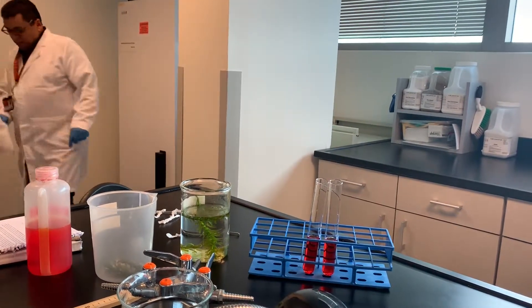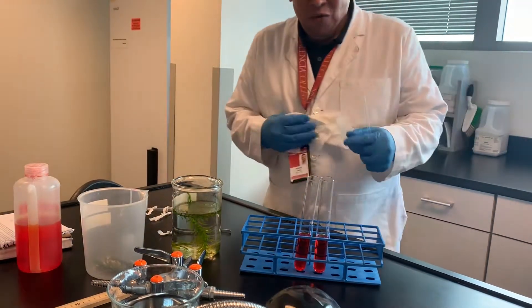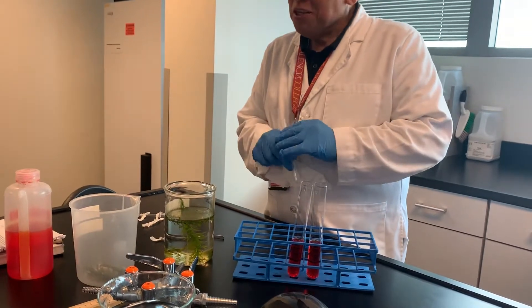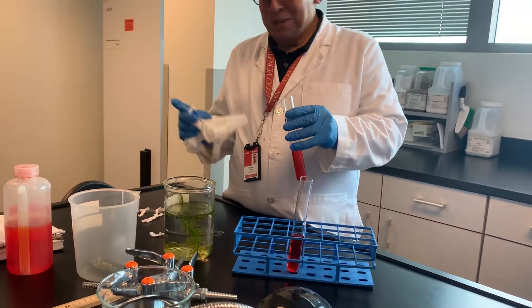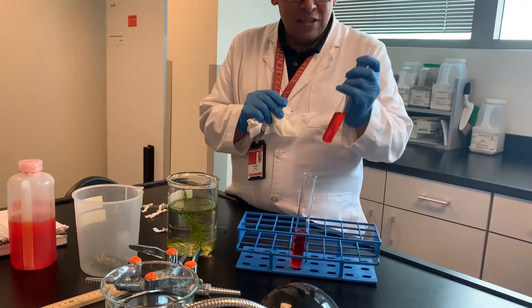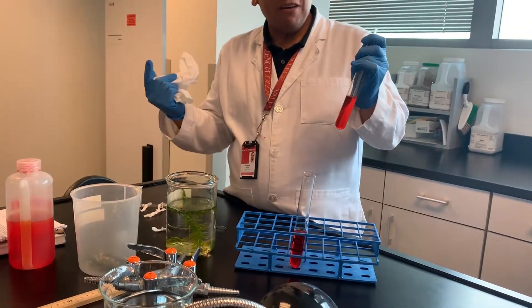I like to use these paper towels for safety purposes. We used to have students do this until we started losing students — just kidding. You have to put the straw in here, and the whole idea is that you're going to blow out the CO2 from your cellular respiration.